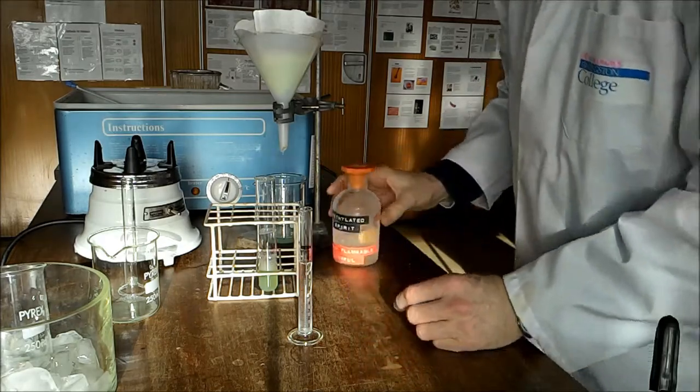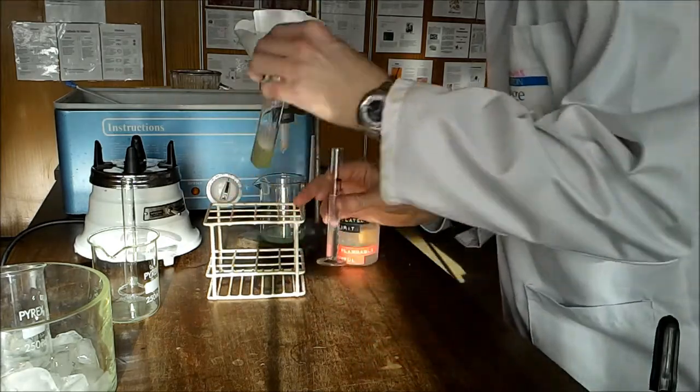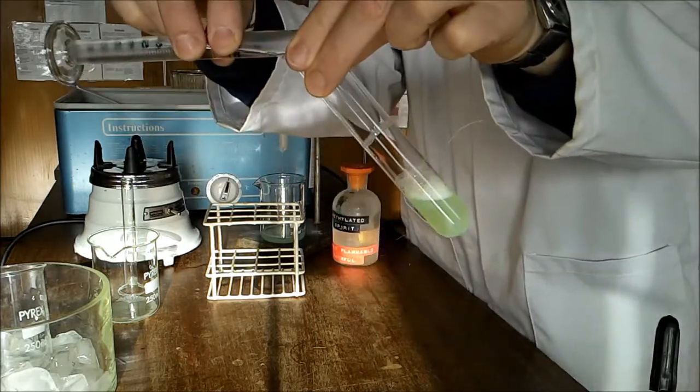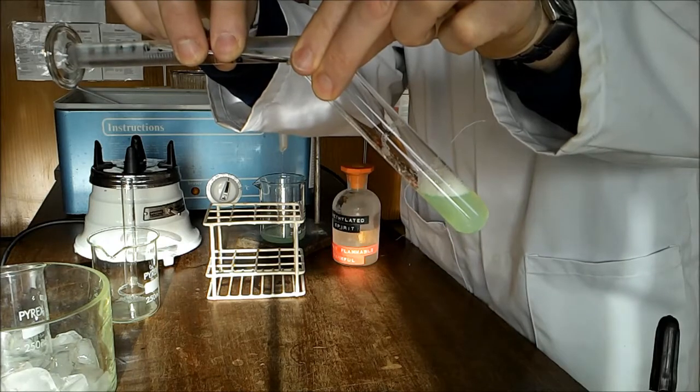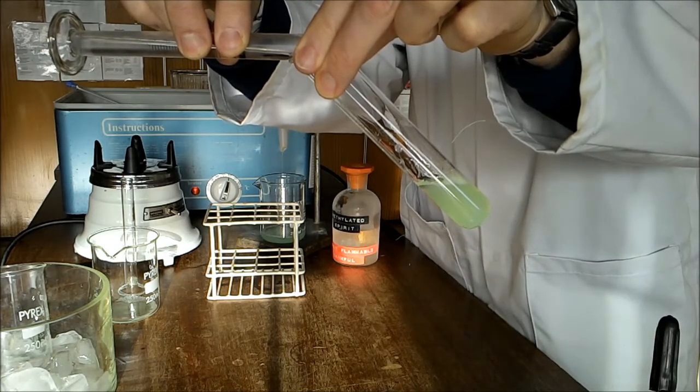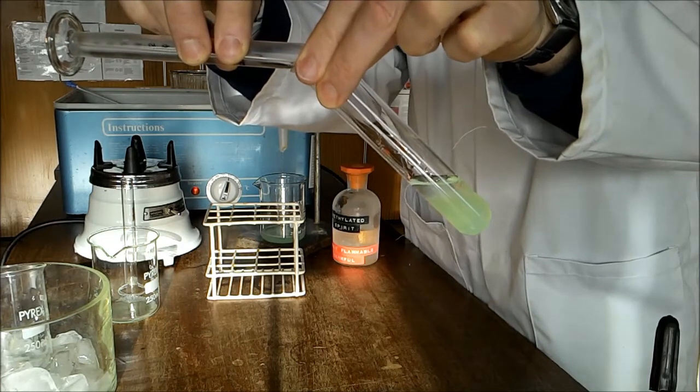We need to add this gently to the side. The DNA will not be soluble in cold ethanol.